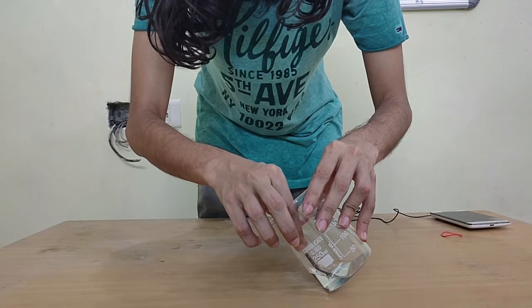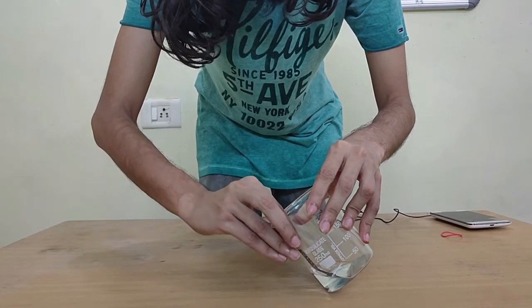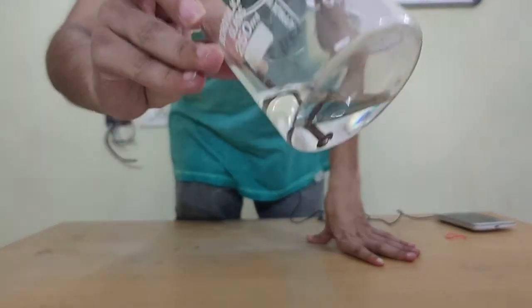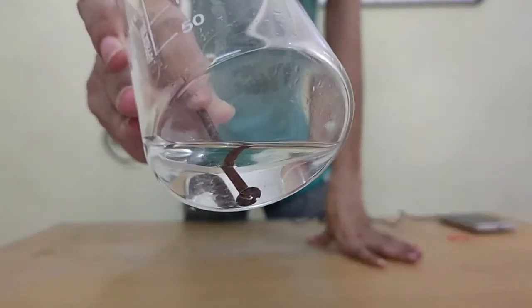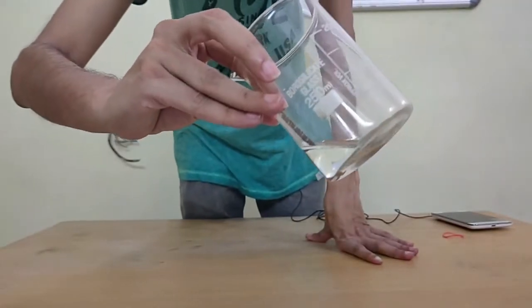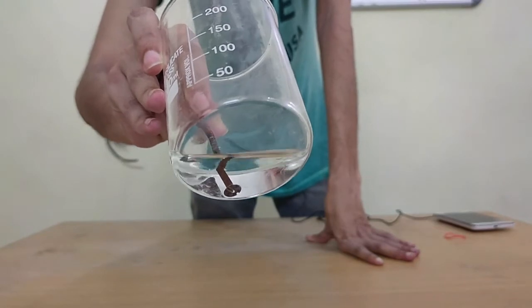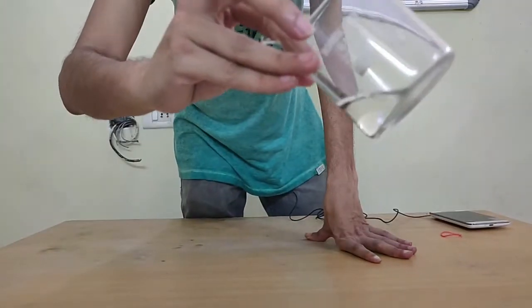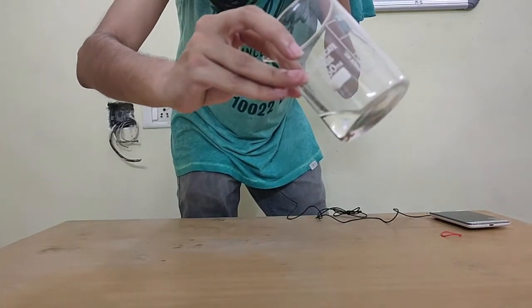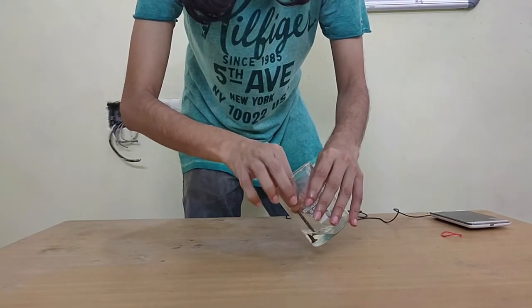There's definitely some change happening that I'm going to try to show to the camera. I'm not very sure if you'll be able to see, maybe from the bottom. Forgive me if you are not able to see, but there are really minute changes happening to the screw. The screw will look bent, but it actually isn't bent. That is refraction, some other topic that we'll learn about. For now, let's just focus on this reaction.